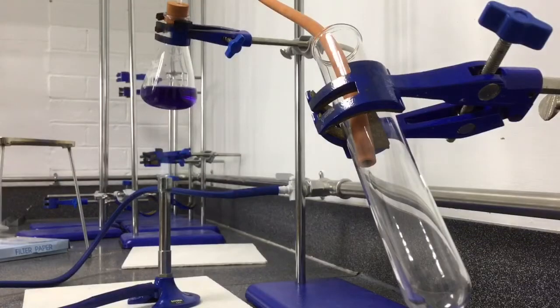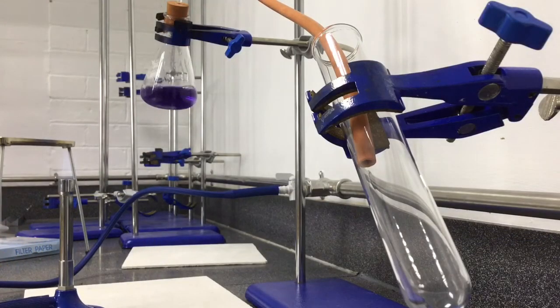The gas vapor will then travel down the tube, condense, and then collect in the separate test tube.